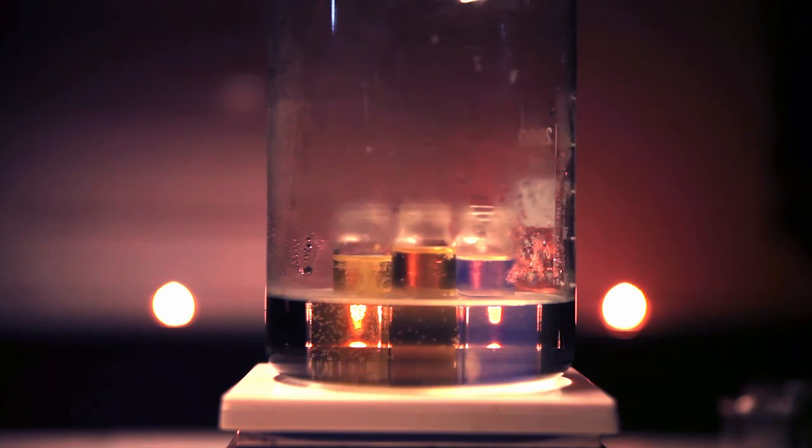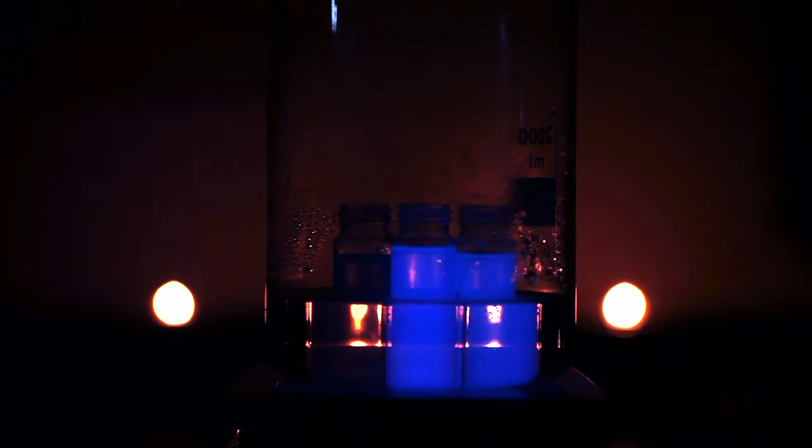I've used these small vials for testing out the luminol concentration. My mix is based on one developed by Hernan Pripstein, but other papers had noticed that you could get the luminol brighter at higher concentrations without wrecking the oscillator. So this led me to increase my concentration that you'll see in the instructions on the technician sheet.